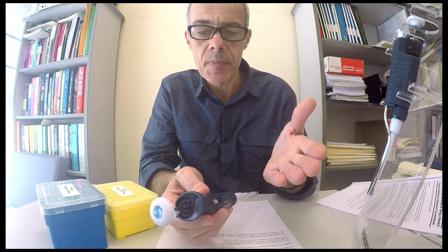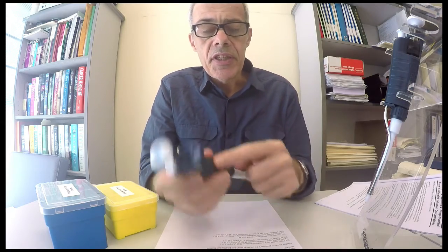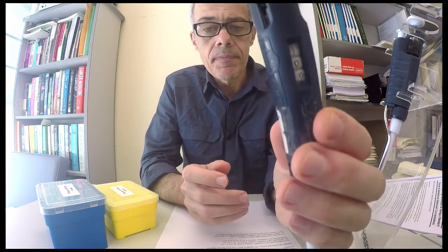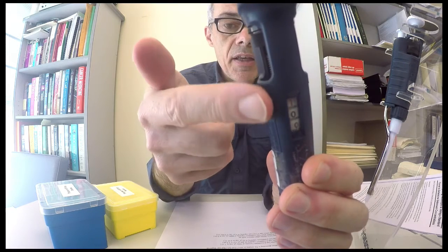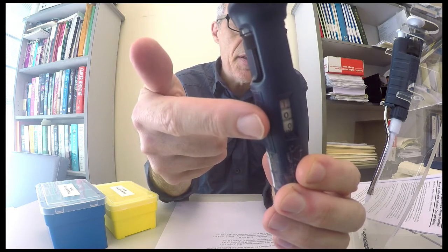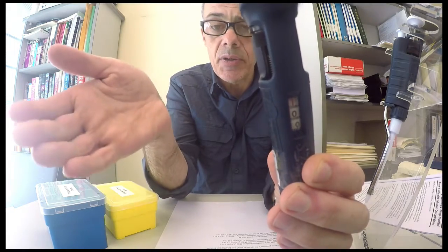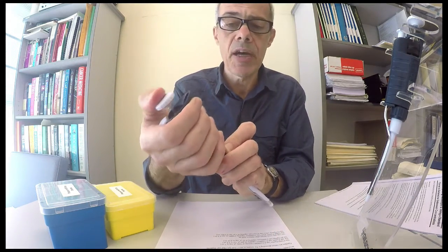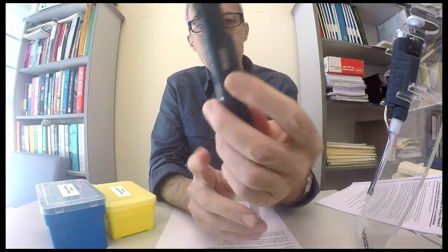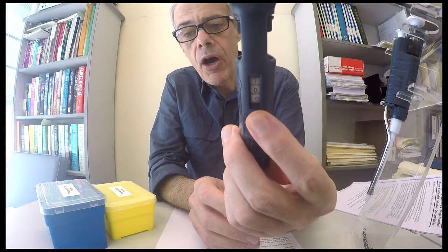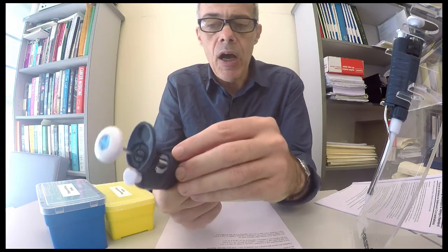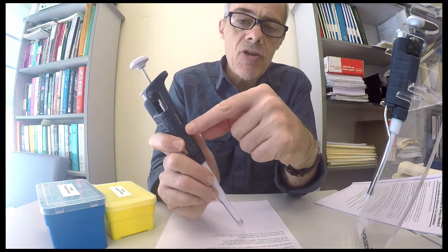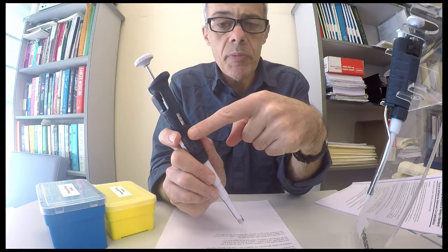There's a scale on these and the scale here at its maximum setting is clearly going to represent a thousand microlitres. So this is set to a thousand microlitres and the unit here is 100. So the zero for the smaller volume is not shown.